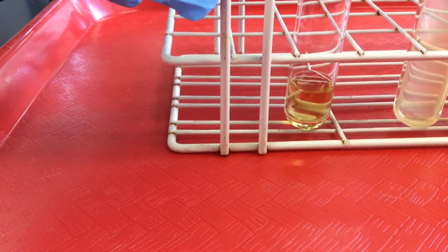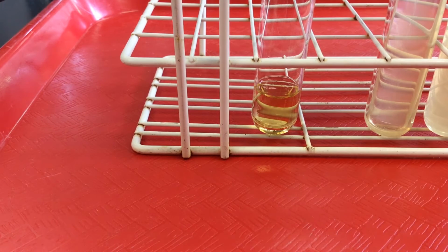The first topic we're going to discuss is how we grow our microbes. Mostly we'll be working with bacteria in our lab. So we want to discuss how we will encourage our bacteria to grow and divide. And of course, they, like us, require food, nutrients. We refer to the food that we provide our microbes as media; media is plural, medium is singular.